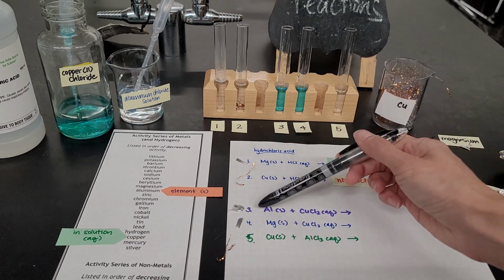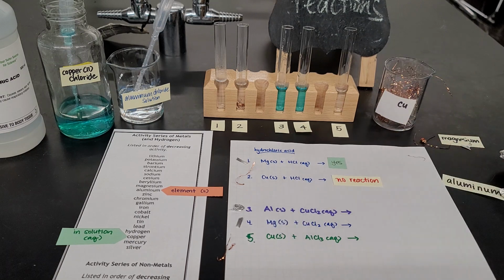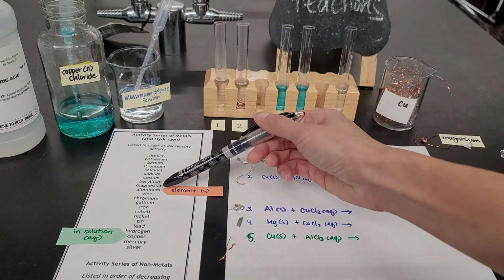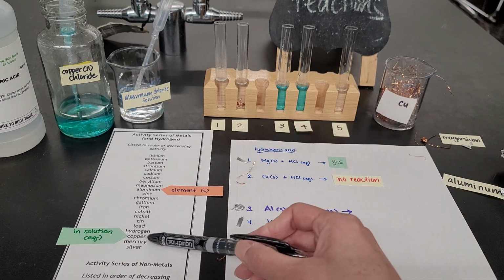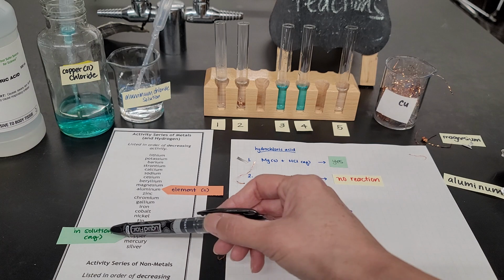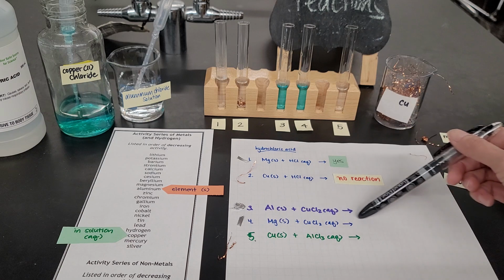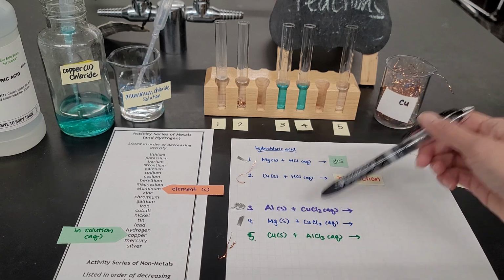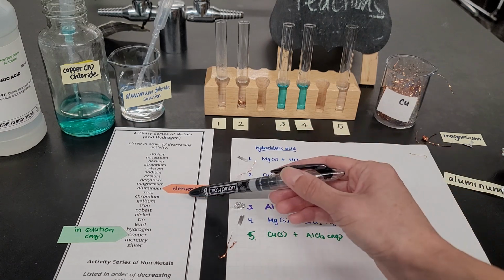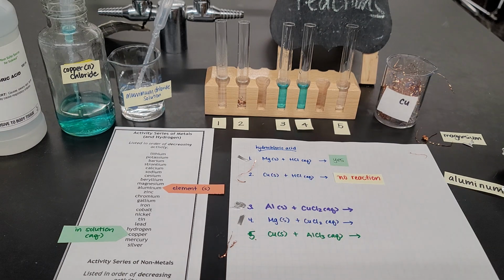In test tube number 3, I'm going to put a small piece of aluminum. And in test tube 4, I'm going to put a small piece of magnesium. But before I do that, let's make a prediction. Aluminum is the metal by itself, as you can see here. This time, I move this little arrow down to point to copper, because copper is the one in solution. That's that blue liquid right there. For reaction number 3, with aluminum in copper 2 chloride, I would predict that yes, there is a reaction, because aluminum, the single element as a solid, is more reactive than copper in solution. But let's just try.